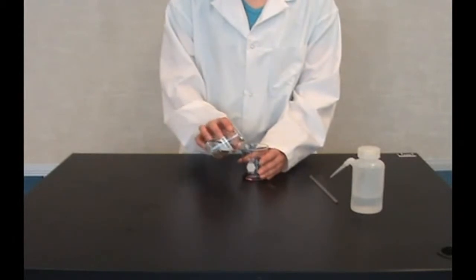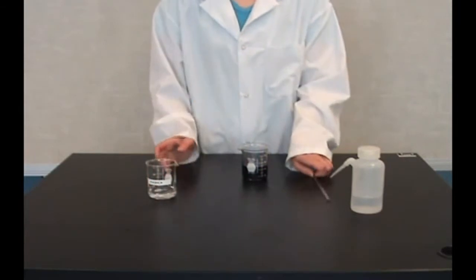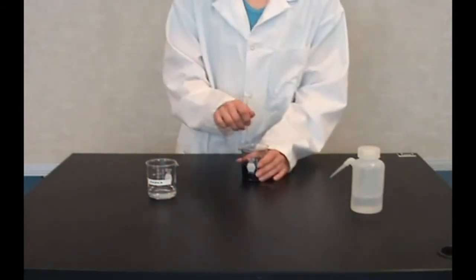Add enough distilled water to completely dissolve the crystals. Stir with a glass rod to help with the dissolving.